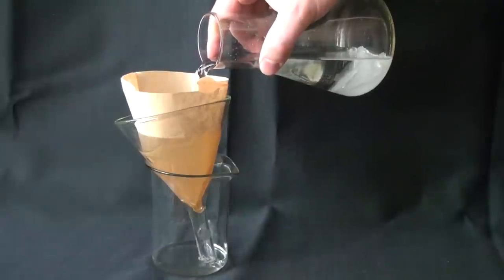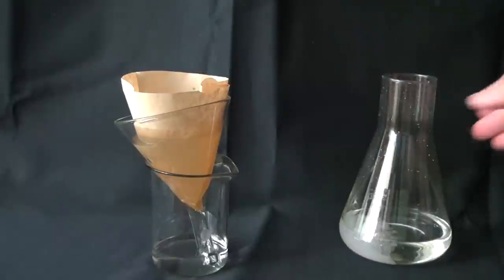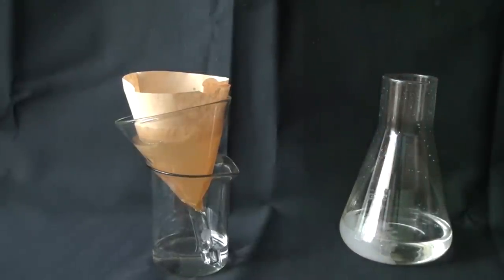However, you should not add a warm solution. The saturated solution should be the same temperature as the growing crystal.